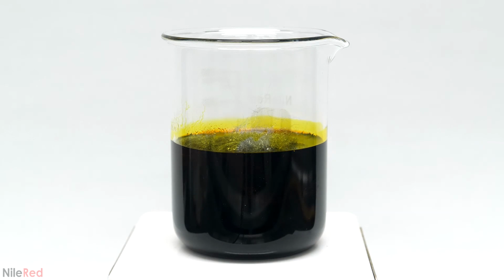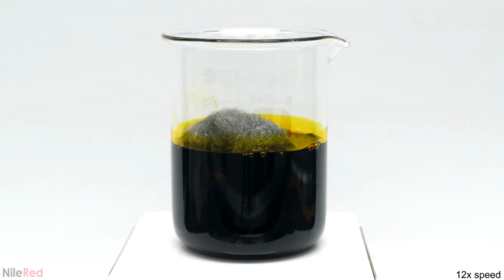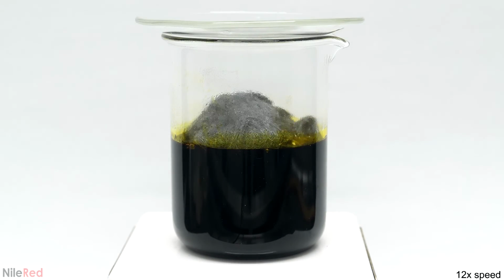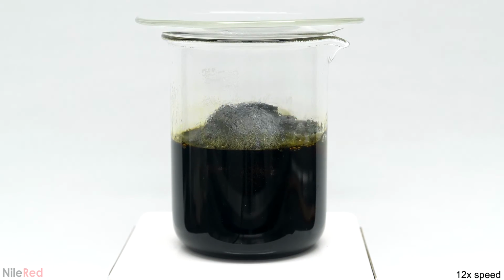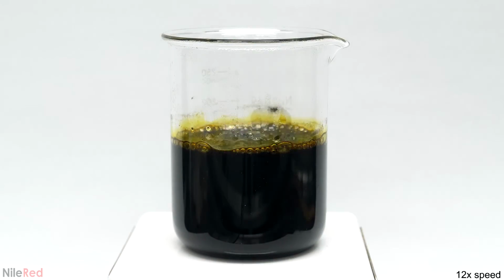This process was exothermic, meaning it released heat, and because of this, the solution slowly heated up. This extra heat was actually a good thing though, because it caused the reaction to go a lot faster. Over the course of just several minutes, the dark red-orange color from the iron 3 slowly disappeared and it started turning green from all the iron 2.